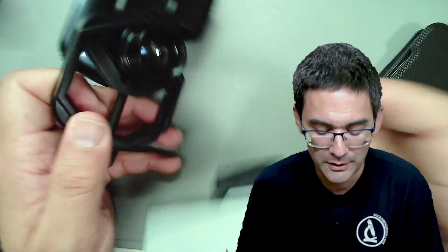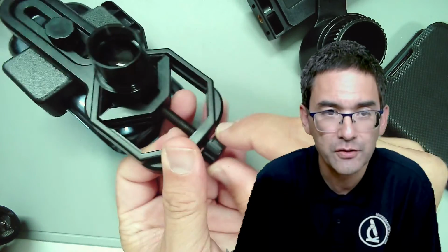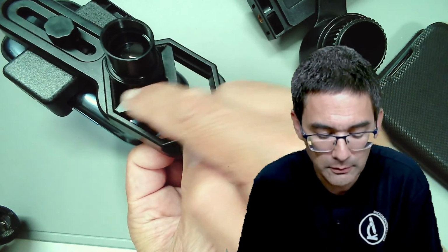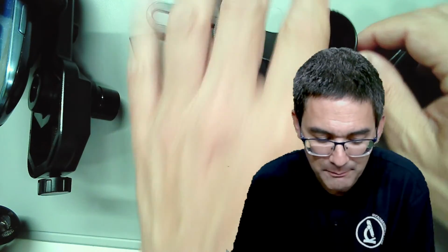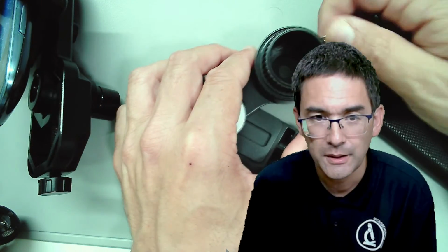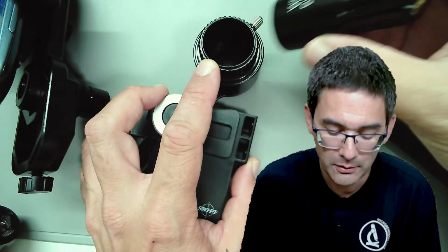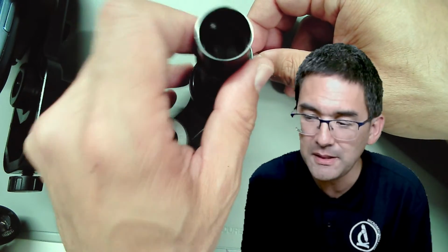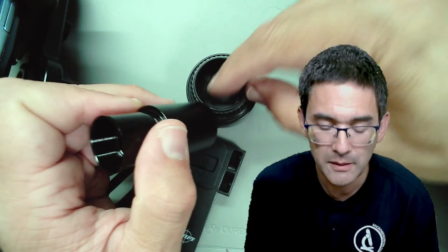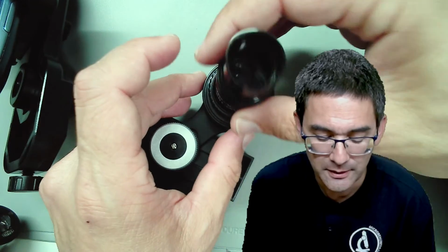possibilities here. So this one here is one, and over here there are other types that you have. Look at the clamp here. You have to turn a screw, and the eyepiece is clamped. And this one over here, you also have to clamp it in by twisting a screw. With those mobile phone adapters, you have to be a little bit careful that the diameter of the adapter actually fits snugly into the eyepiece, because some eyepieces are not quite as thick, and then you need to wrap some paper around it, or you need to get an adapter that fits the eyepiece.